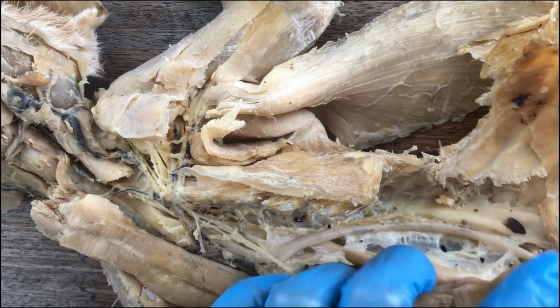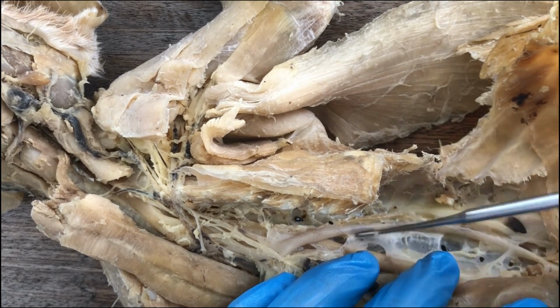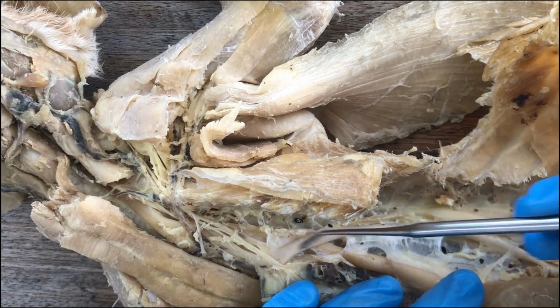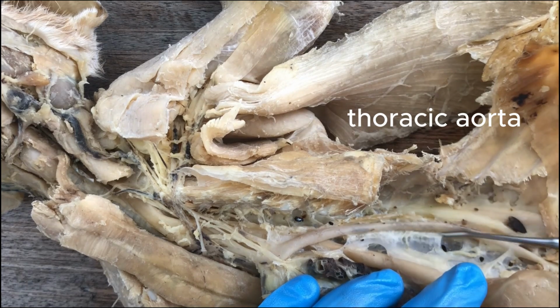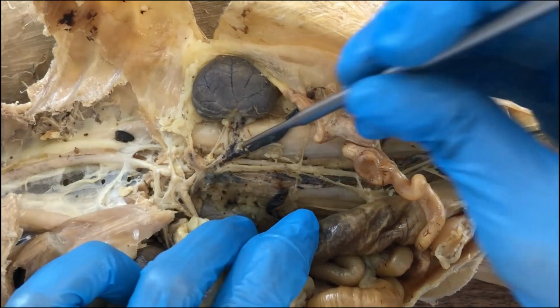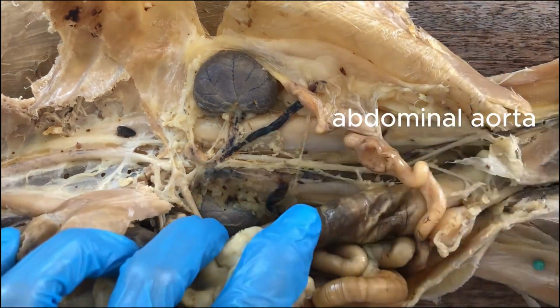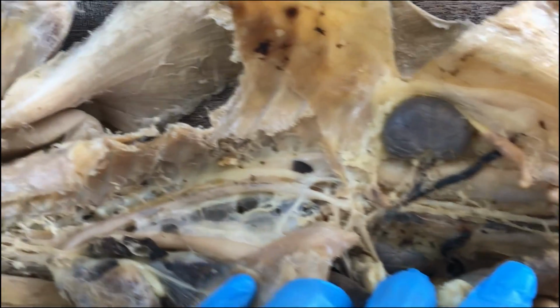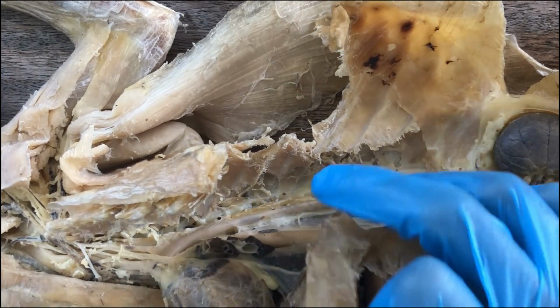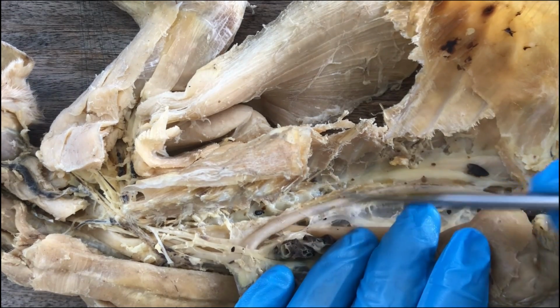and this portion of the aorta that descends down to the dorsal thoracic wall and eventually reaching down into the abdominal cavity, this is the thoracic aorta. Once it reaches the abdominal cavity, it becomes the abdominal aorta. But it's still basically the same artery, the aorta, having different names in different portions of the body. So let's examine in this video the branches of the aortic arch and the thoracic aorta.